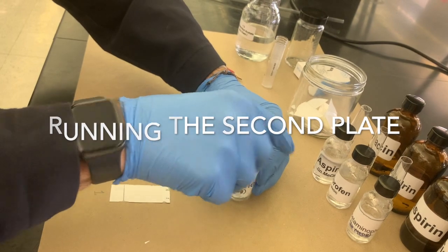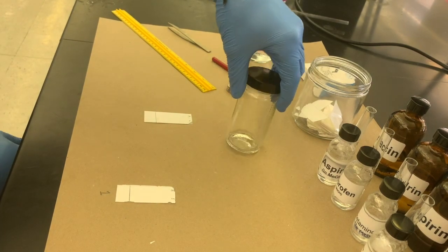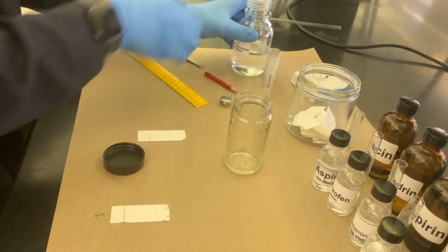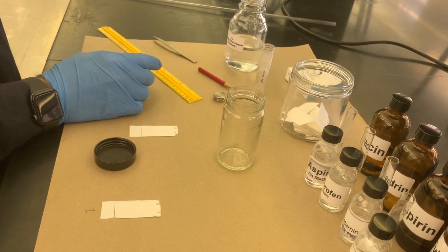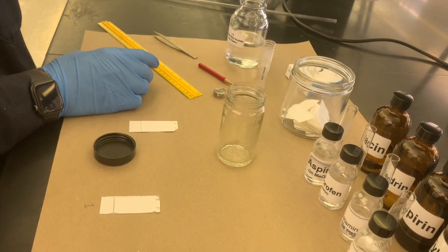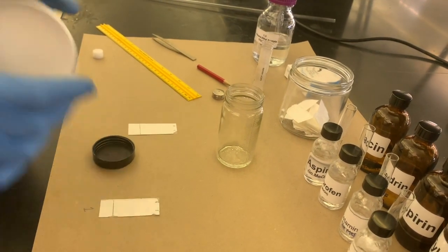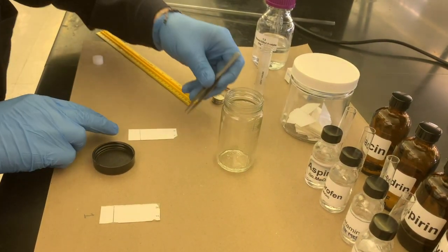Close up that caffeine, and we'll get the TLC plate ready to go for the next trial. Now there's plenty of solvent still in there. I'm gonna add a tiny bit more just to make up for whatever we lost through either evaporation or from soaking into the plate and coming out with it. Just a little bit. You don't need much in there at all. Big mistake I usually see people just getting used to this stuff doing. Close up these plates too to keep them clean. And we will begin.